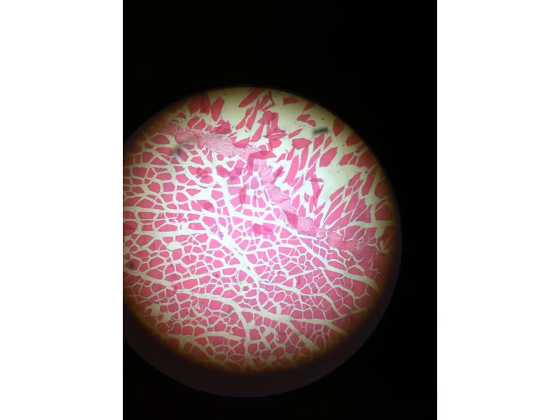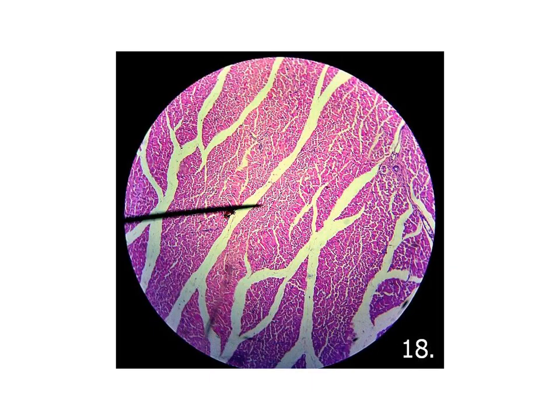Another picture for a transverse section of the skeletal muscle, and it is very evident. As you see, you can find the bundles of the skeletal muscle fibers, and they are transversely cut, of course. The fibers are here more or less polygonal in shape, and they are separated by this white area representing the damaged connective tissue. Also, another picture of the transverse section in the skeletal muscle, formed of bundles separated by this white area of connective tissue.